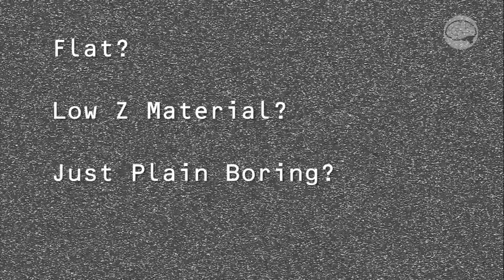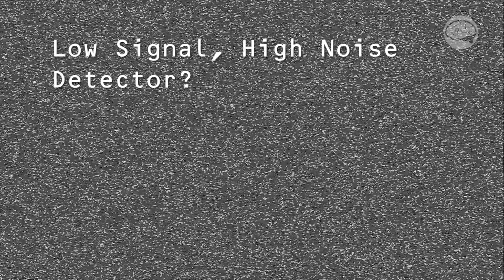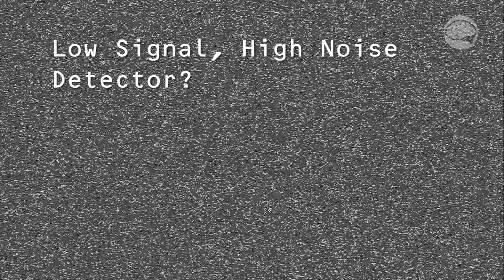Well, first off, why is the image noisy? There could be several reasons as to why it looks like this. First off, you may have a sample that just doesn't give off much signal. Maybe it's very flat. Maybe it's made up of mostly low atomic number elements. Whatever. Another option is that maybe you're using the backscatter detector, which may have a poor signal-to-noise ratio in a fast scan speed. Or maybe you're using some other detector, which is just very noisy at fast scan speeds. But whatever the cause is, the bottom line is that your image is super noisy because you don't have enough current hitting the sample to form a good image in a faster scan.